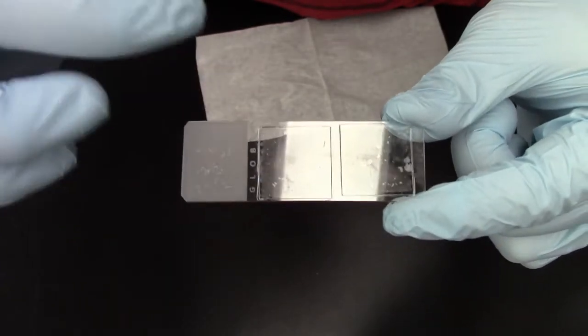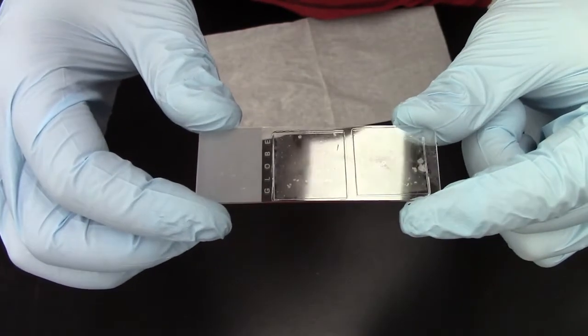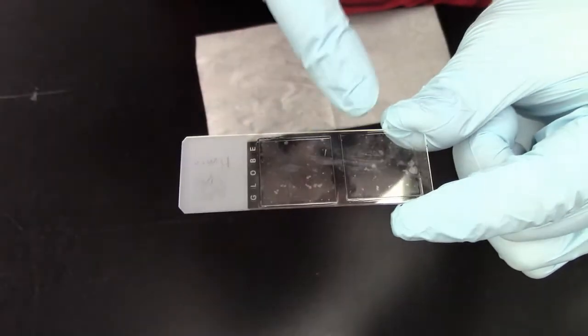So if you were to try to image now through this haze, through this cloud, you would not get a good image. And so we have to clean the coverslip.